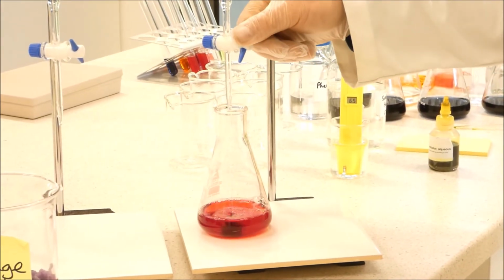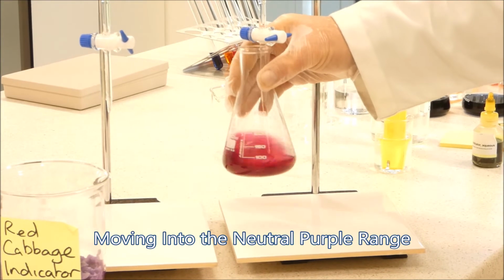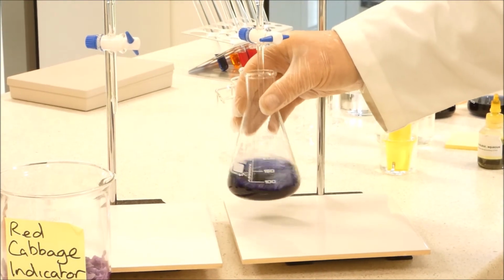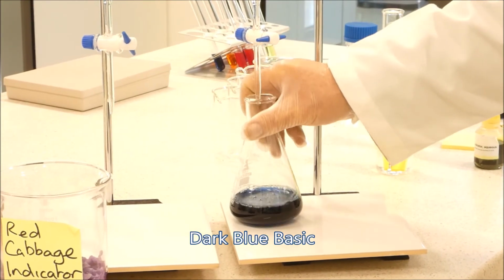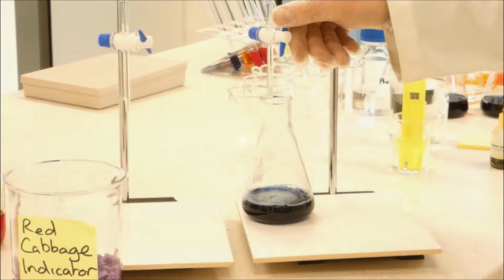So we've gone from ruby red to a sort of more cherry pinkish red now. And if we add more still, we went through a bit of a purple colour for a second there, which we saw. And eventually it turns into a nice dark blue colour when we get up to a pH of about 11 or thereabouts.